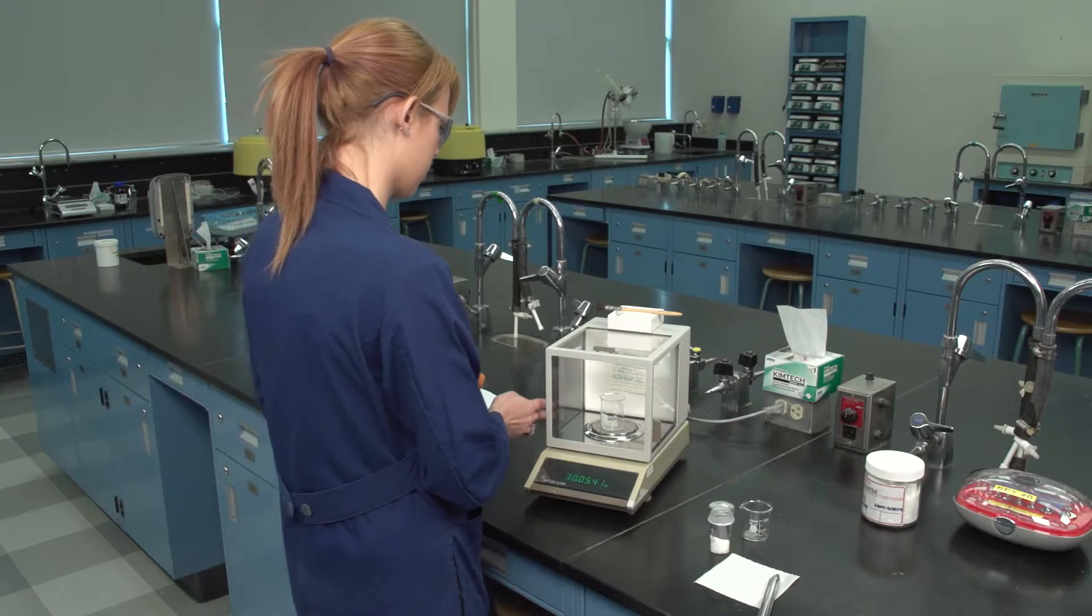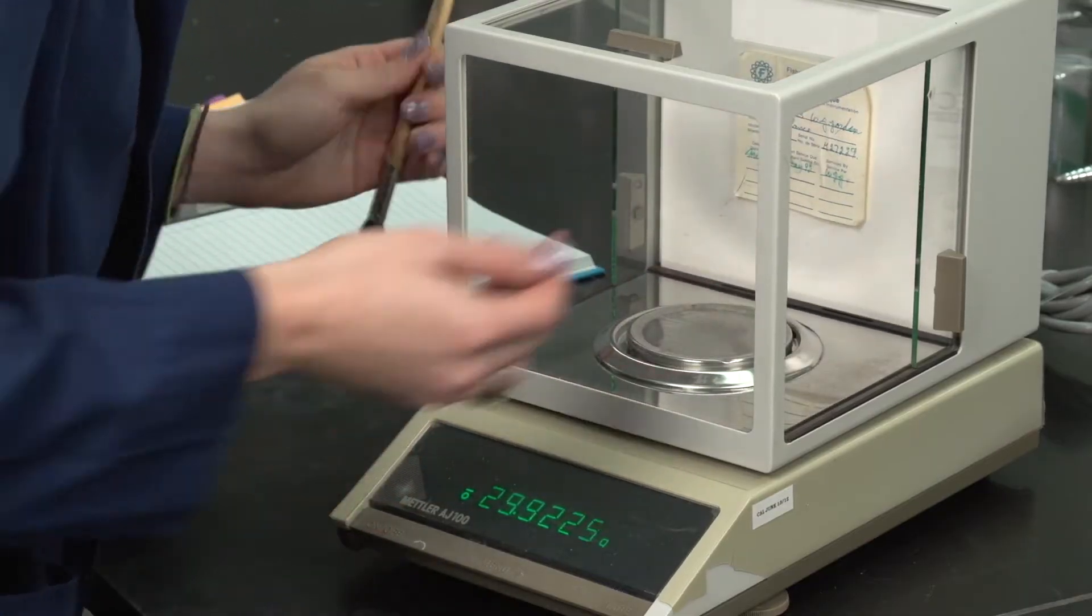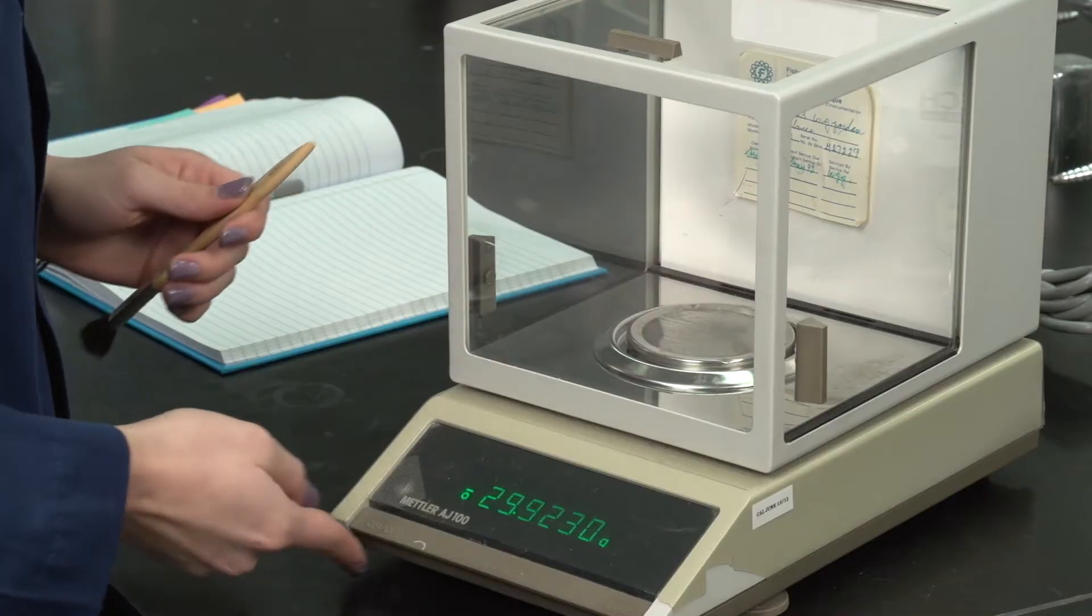Repeat the procedure until the required mass is obtained. Record the mass. Once all of the required samples are obtained, ensure the balance is clean and turned off.